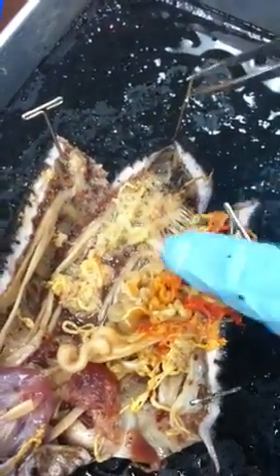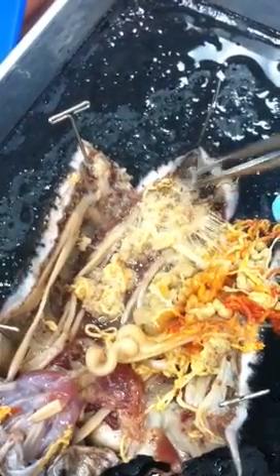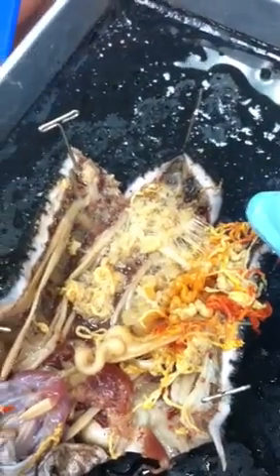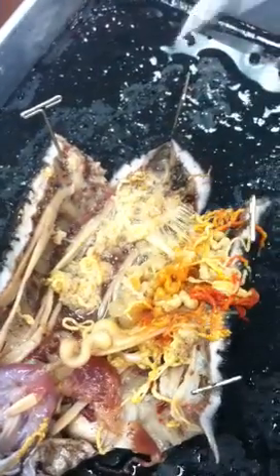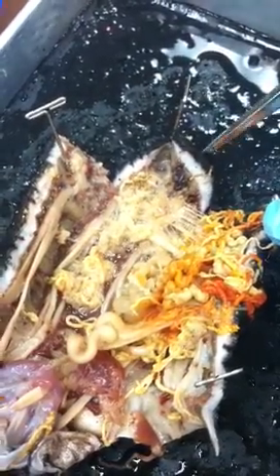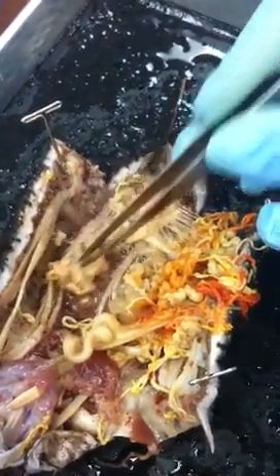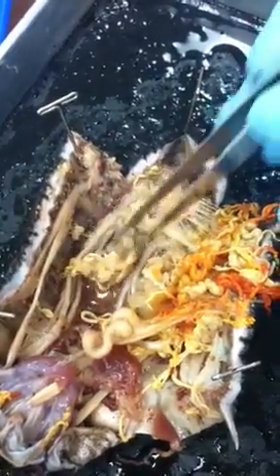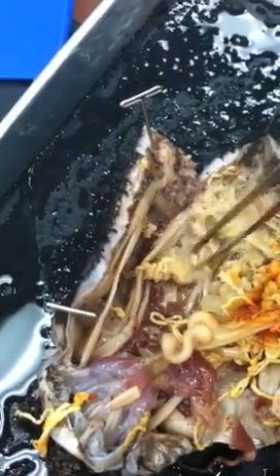The thing that's really weird about this is you look at the cloaca and it's got all of these muscles that come off of the side, and you're like, what? Why would it need those muscles if it was just putting stuff out? Well, it's not. It also pulls water in. Okay. And so how these guys respire is they pump the cloaca back and forth using these muscles, and it pulls water in through the cloaca and up this thing here, which is the respiratory tree, which I think looks kind of like gills. It has that same wet, branchy kind of look.